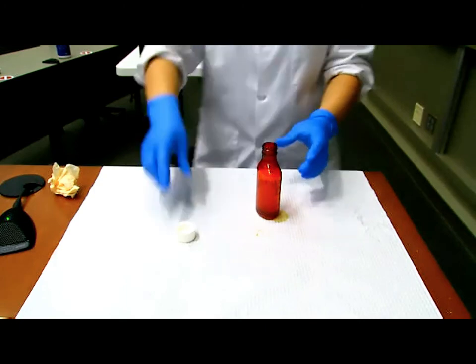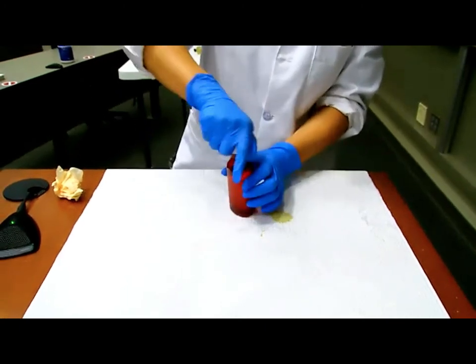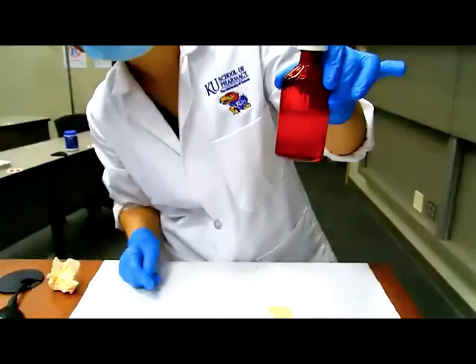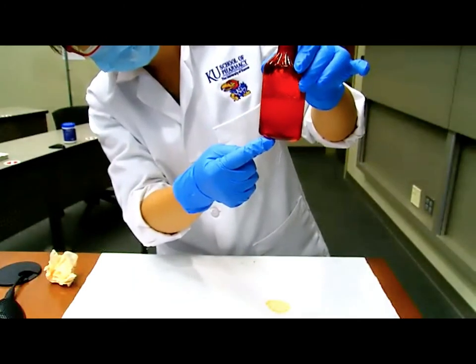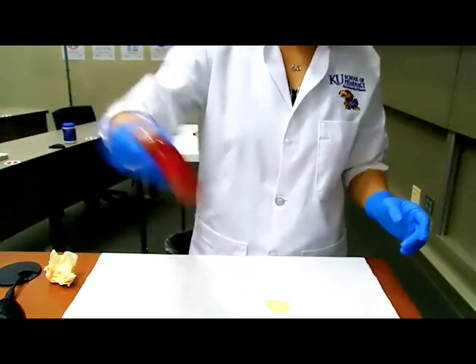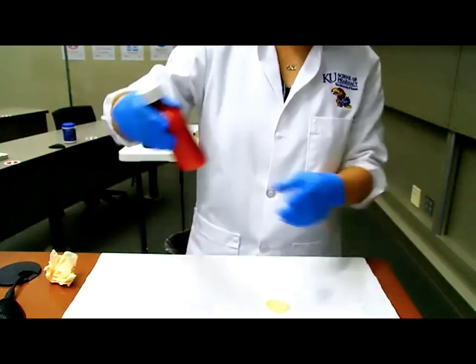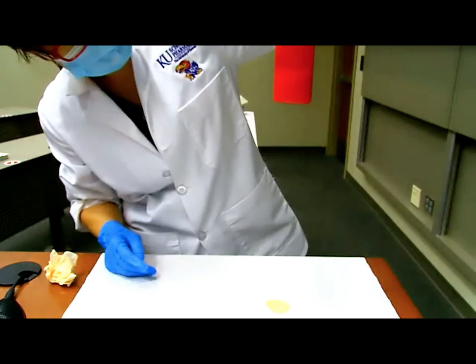All right, this is not quite ready yet though, because it's not quite emulsified at this time. Can they see well? Yes, I think you can see there's a clear phase on the bottom and a little bit of a cloudier phase on top. So as we said, the oil and the water themselves don't just generally mix. All right, so what should we do then? Go ahead and mix really hard one more time. And at this point, if you look one more time, you shouldn't see the separation of those two layers anymore.